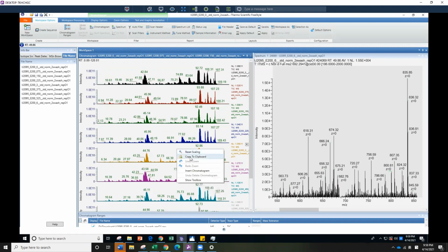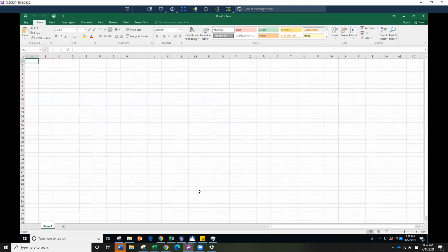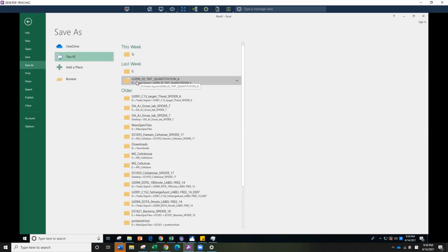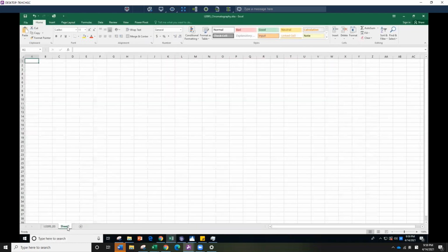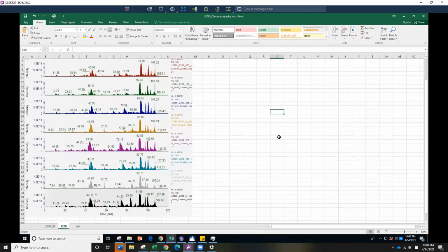So if you come here and copy to the clipboard and then open the Excel file, you can paste it and then save it somewhere. I like to do it in Downloads for now. I have a hard disk on the computer. I think I actually already have another file for this set of data, but I'll do it here. I already have one, so I'm going to open the file and save it as E0, so this is E200. Just save it, or print it to your notebook, or save it in your files to make sure you have it saved and available.